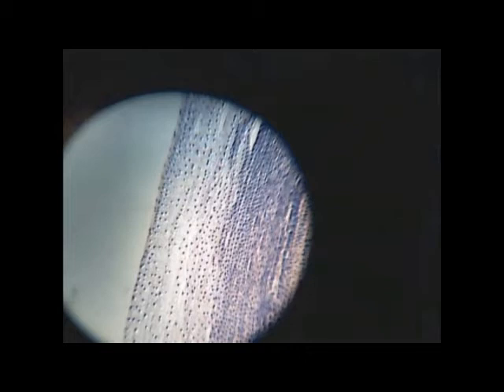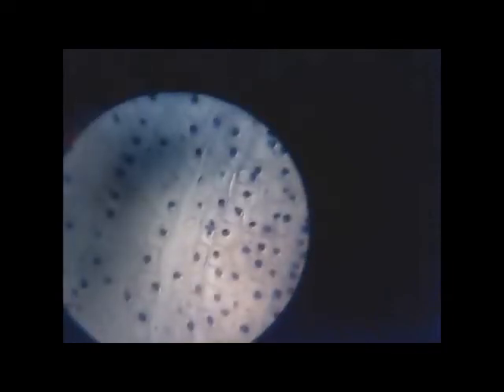If you digital zoom in we can do that, but like I said it's not going to show much detail — you're just increasing digital magnification and getting pixelation, not a true optical zoom. Now let's move on to high power — this is 400 times. Fine adjustment — there we go. Excellent image of the nucleus! And because this is a plant cell, you can see the cell wall and the nucleus in the middle.